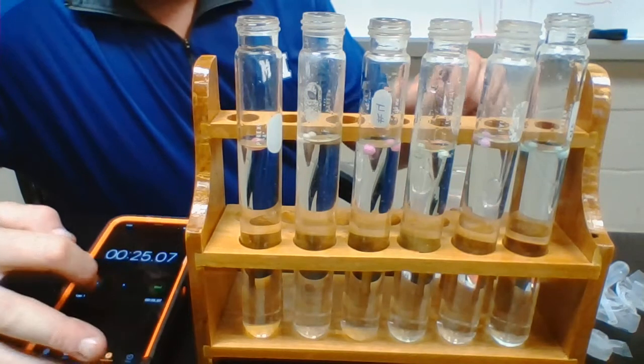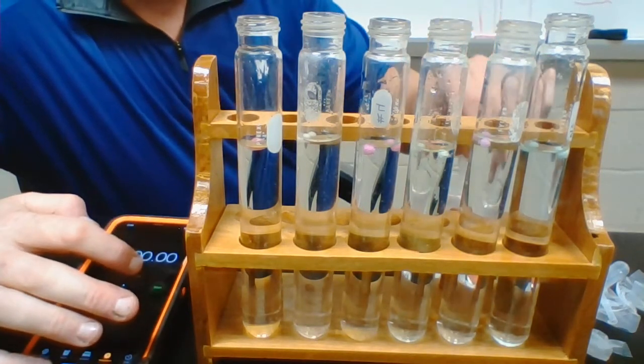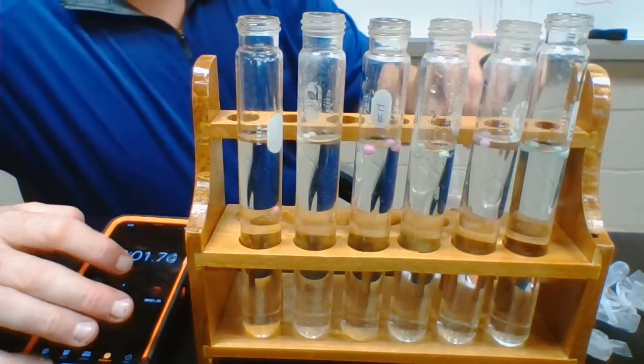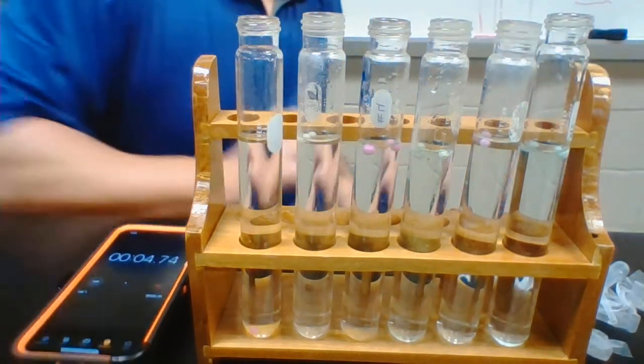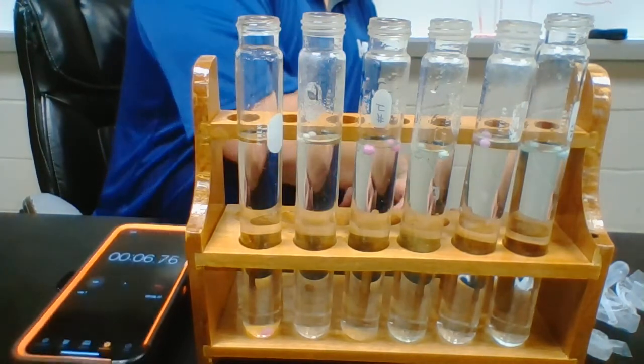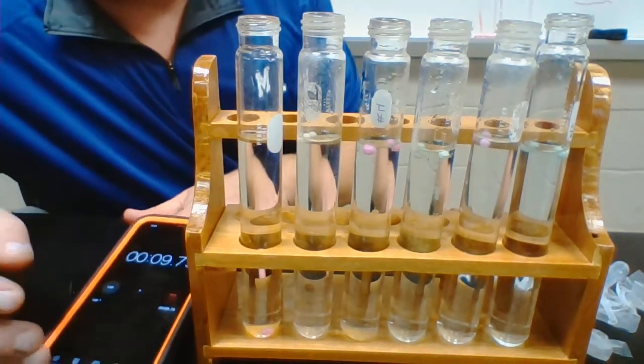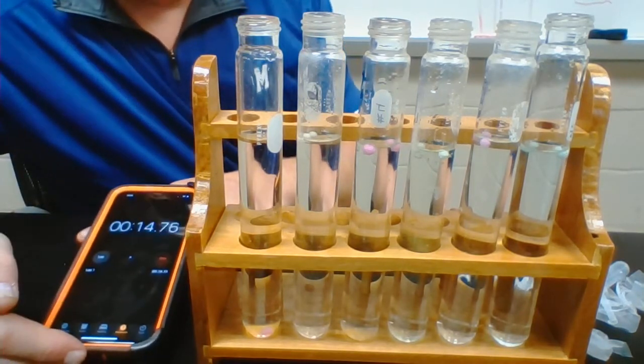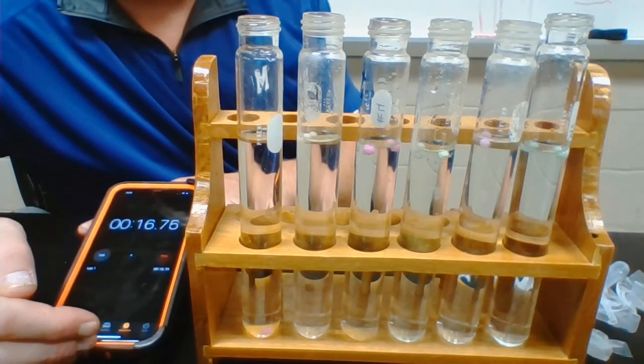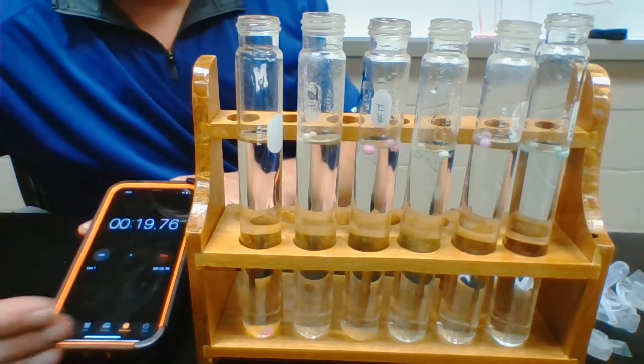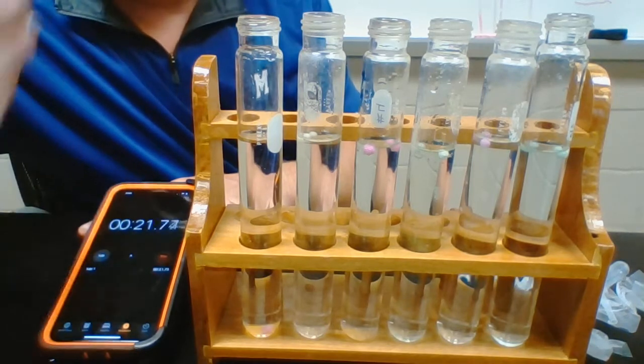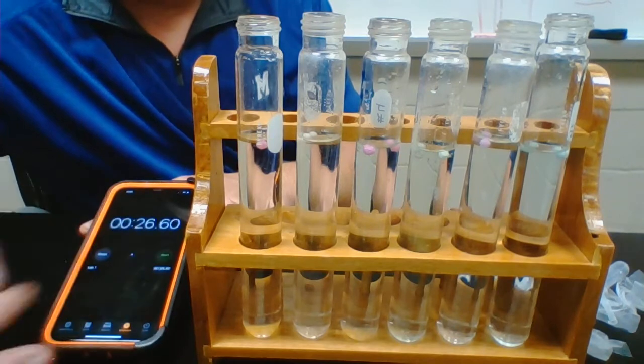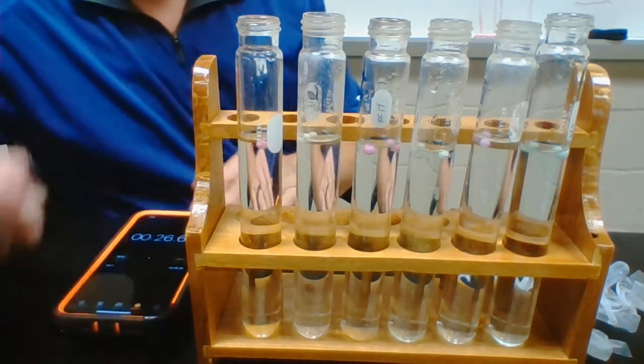Okay, and one more time. Reset. One, two, three, start. Alright, so it looks like the stronger salt solution is denaturing the protein more. It is lowering the activity of the enzyme. So just think about when you get a fever, think about when this goes on in your body. You're just feeling weird, right? You've got a headache, just things ain't working right like they should. 46.60 seconds.